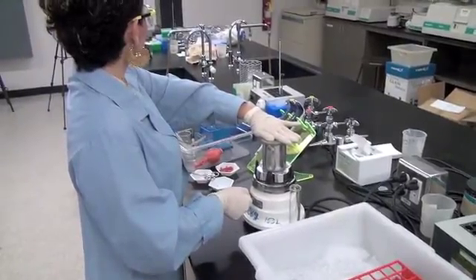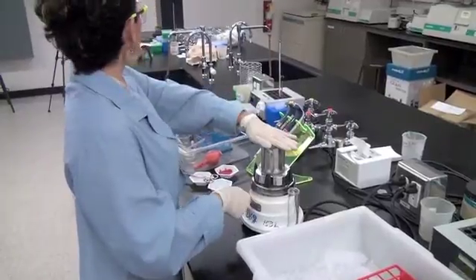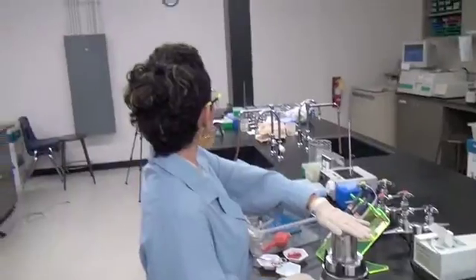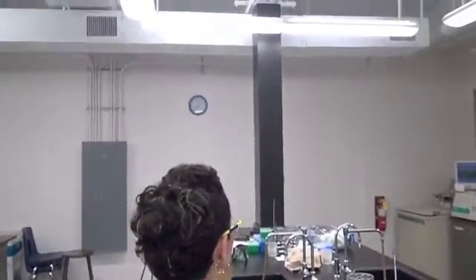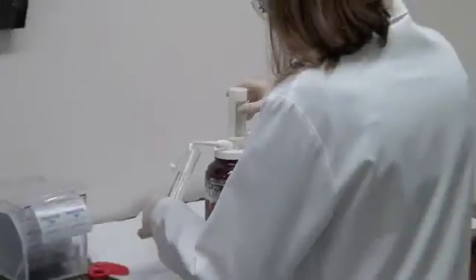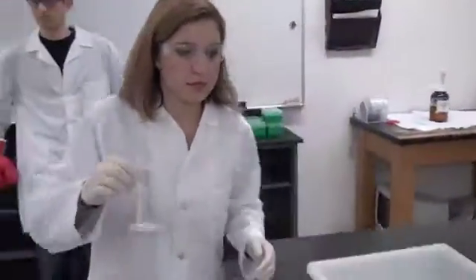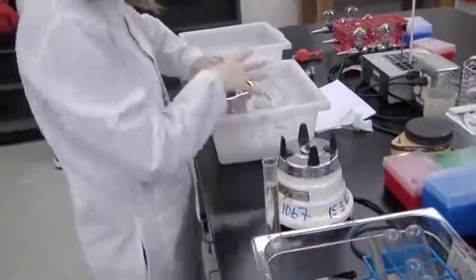These are great industrial blenders, but those lids are hard to replace. They are not disposable. That's correct. Here in Hemoglobin Arena, all equipment must be washed and returned. Nothing, including dilutions and samples, should be immediately thrown out without careful consideration or even consultation with Master TA. Competitors can lose points for any missing items. Biochemist Dicer has now shut off her blender and is waiting 30 seconds before blending again. She is mindful that the blender cup could heat up if she extended that blending time.